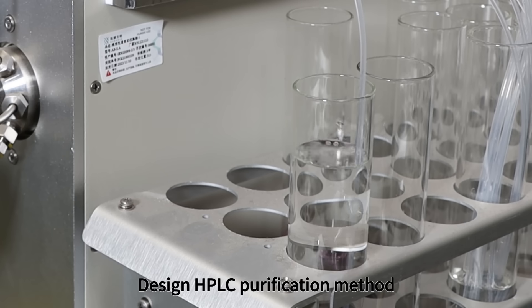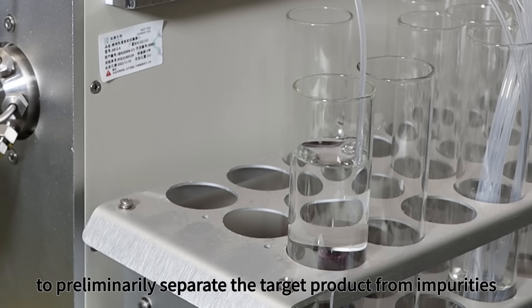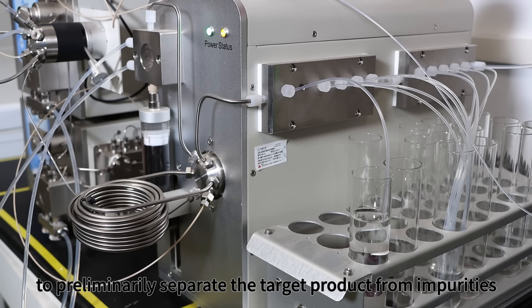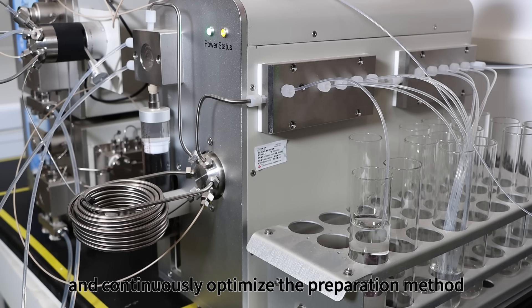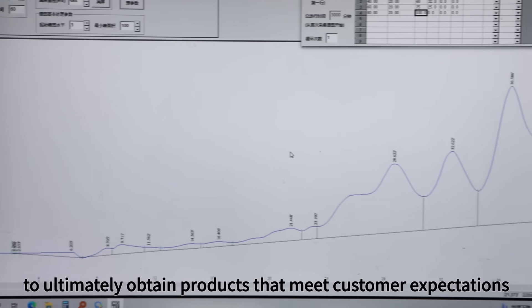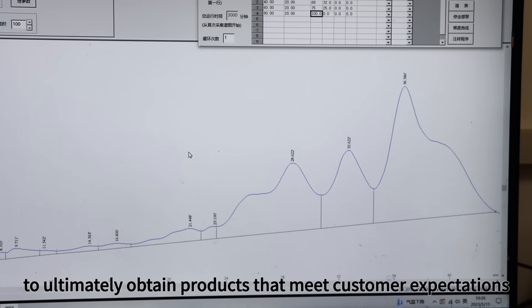Step 5: Determination of preparation method. Design an HPLC purification method to preliminarily separate the target product from impurities, and continuously optimize the preparation method to ultimately obtain products that meet customer expectations.